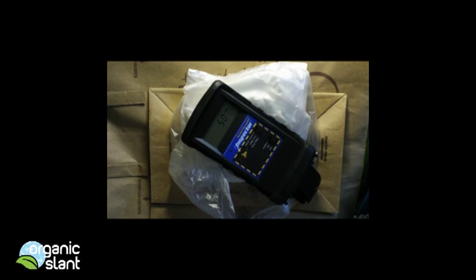Now this would be Alaskan salmon that was caught last year. Then it was frozen, and it just dawned on me, let's test, since I just received my detector, let's test a piece of salmon that's from Alaska.